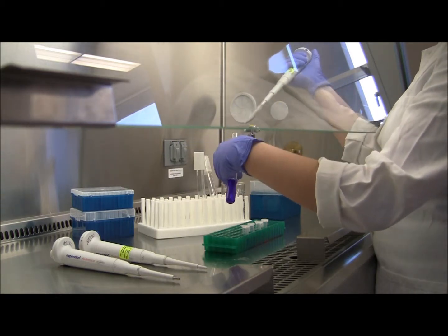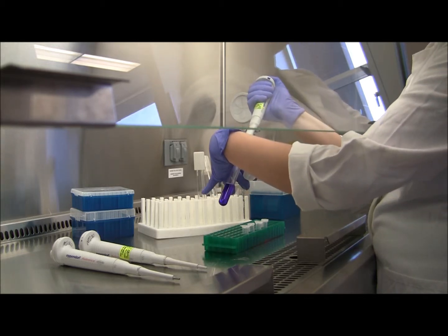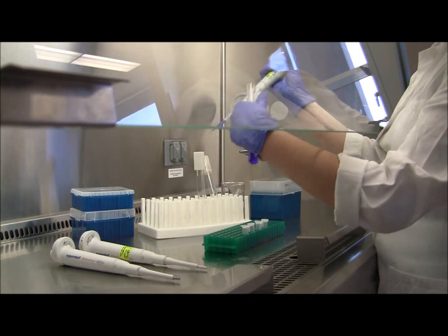When you're ready to pipette liquid, you want to push the plunger of the pipetter down to the first stop before you put the tip into the liquid. Once you're ready to pull the liquid into the tip, slowly pull the button back up, and now you have the correct amount of volume.